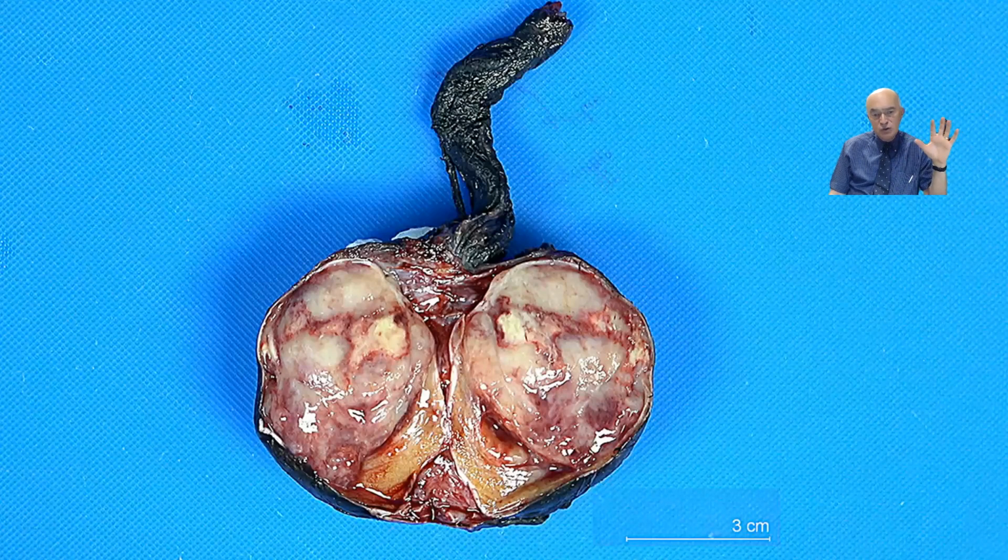Now, when we have this kind of tumors, this is a very large tumor that is involving the testicle, but it has a very irregular appearance, variegated, and this most typically is the representation of a mixed germ cell tumor, in which we can find components of different origins, embryonal, yolk sac, even teratomas. So we need to take samples of all the different areas with different aspects, because since this is not homogeneous, sometimes this area could be just pure embryonal. Some areas could be just teratoma, and also other areas like yolk sac or seminoma.